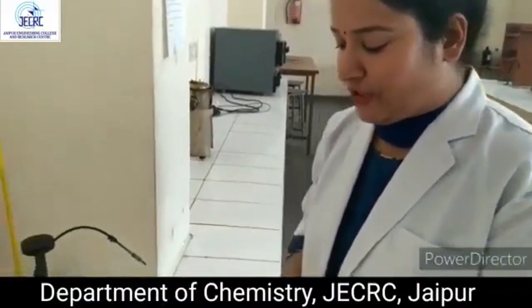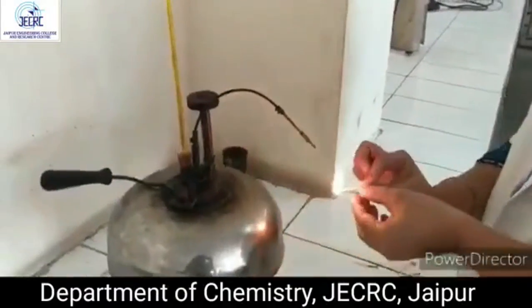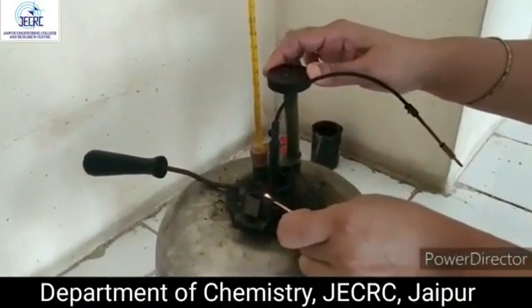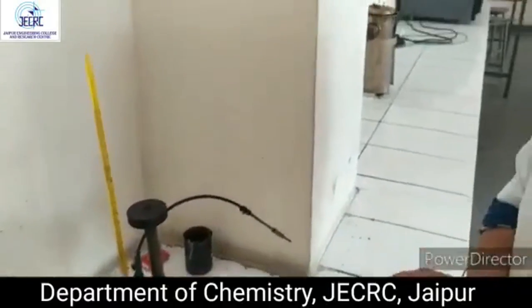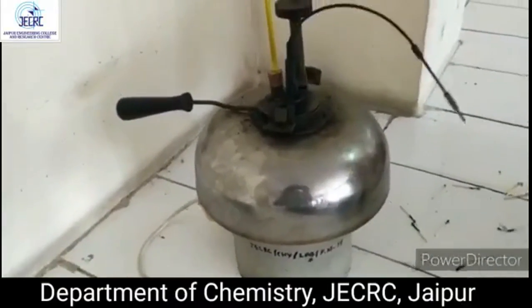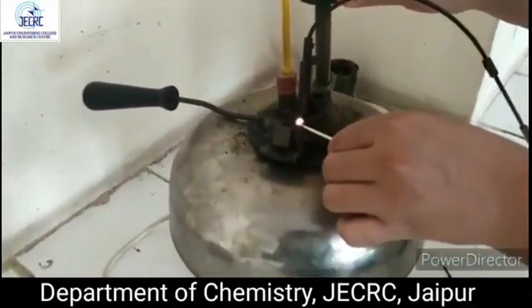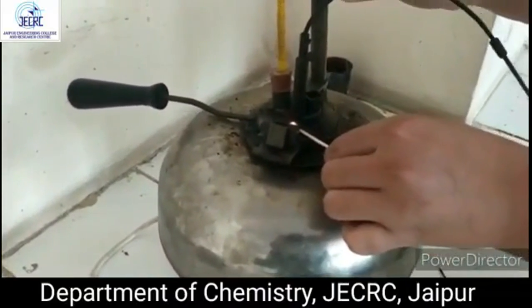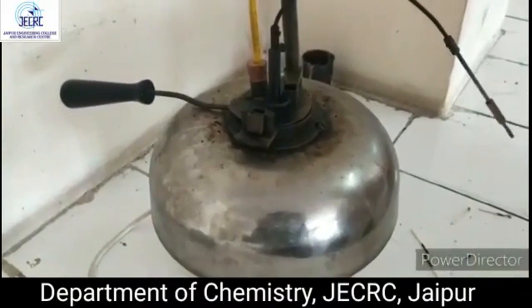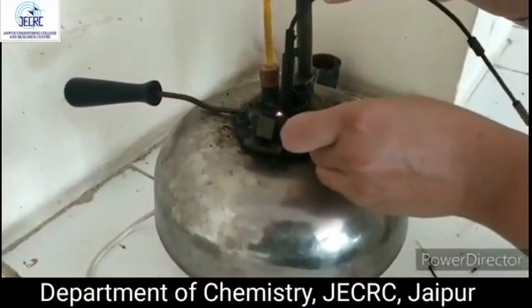Now we will find the fire point and will continuously take the reading. Continuously we are taking the reading for the fire point.